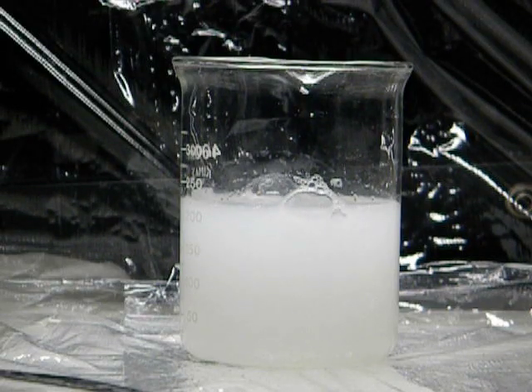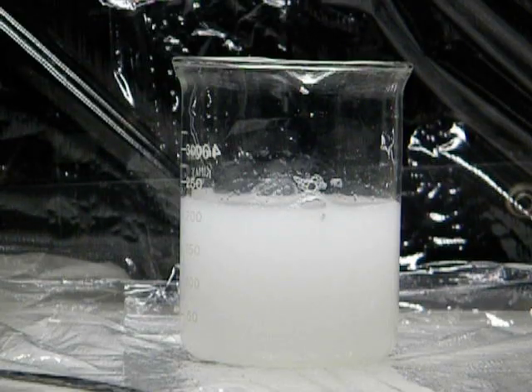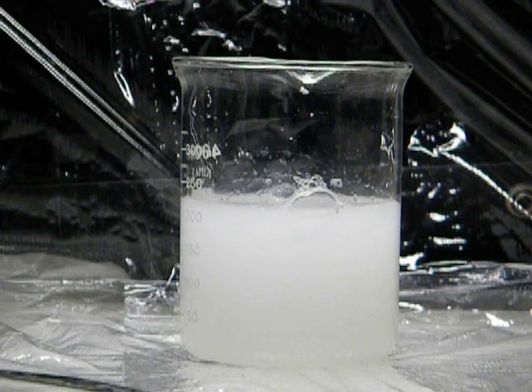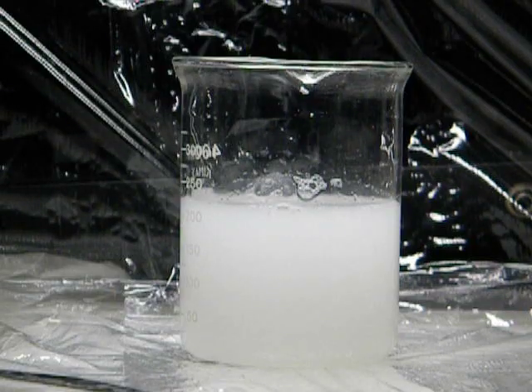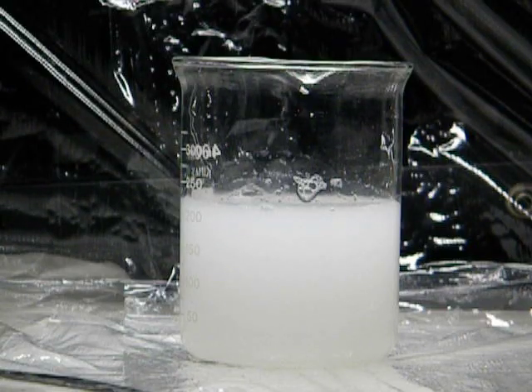How reactive they are with water is one way to test their reactivity, and that's actually what we're doing today. We're going to react each of these with water. The next three are so reactive that they can't be exposed to the air, so they're stored underneath oil. It'll take me a little longer to get them out and ready to go.